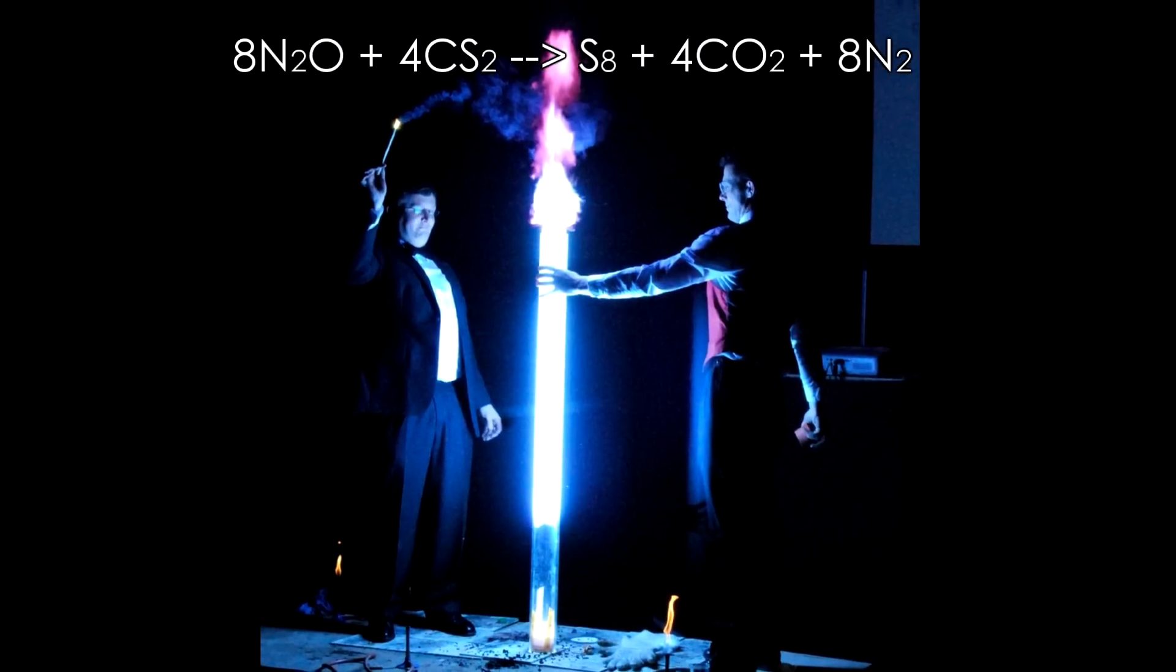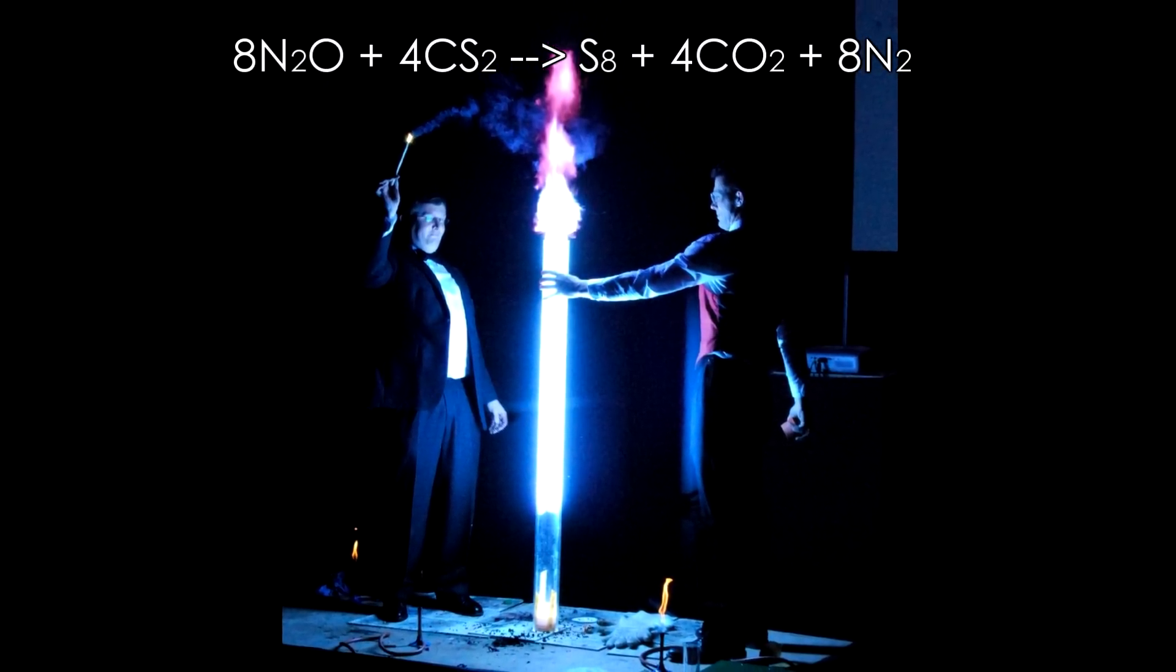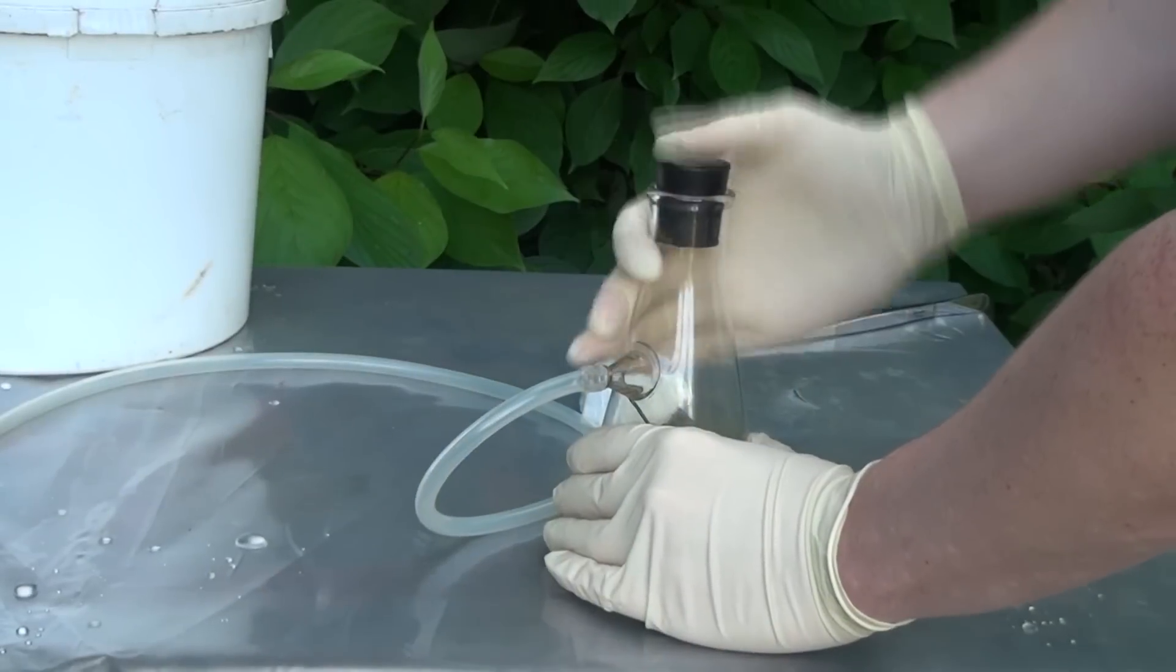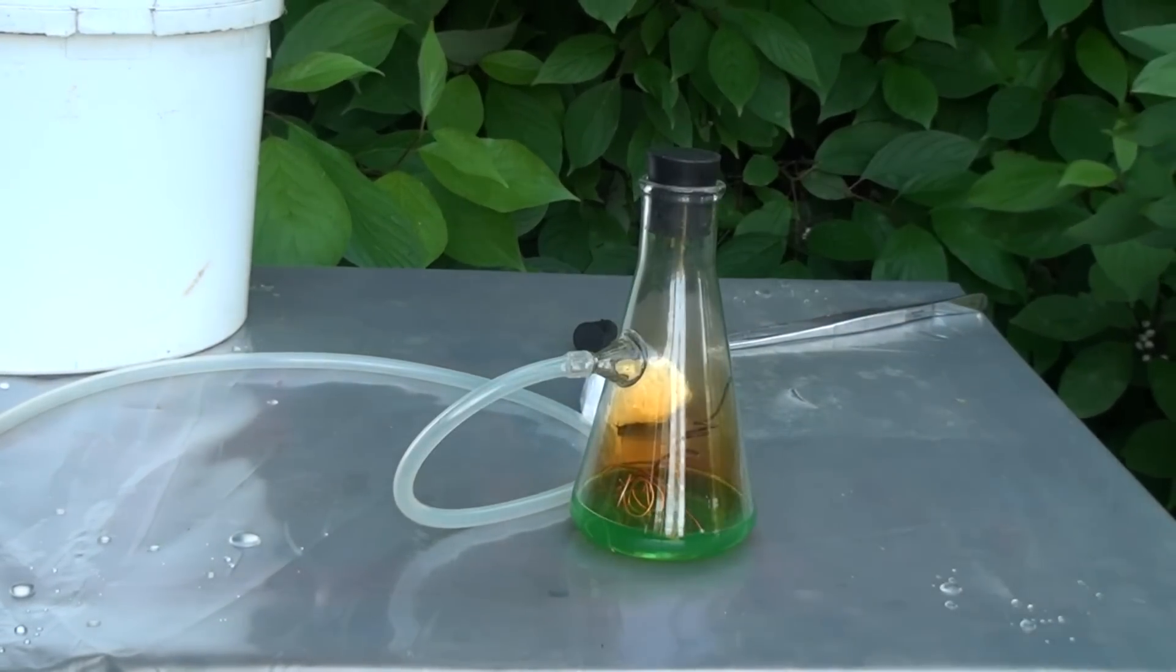This experiment is all about interaction of carbon disulfide with nitrous oxide or nitrogen monoxide. To begin let's see how this reaction happens with nitrogen monoxide.